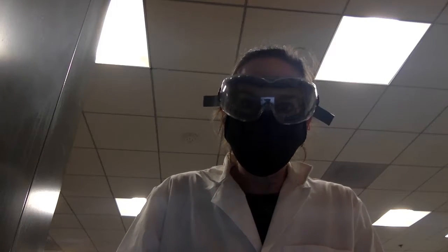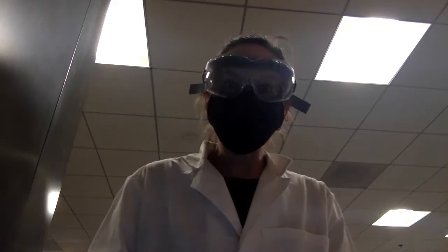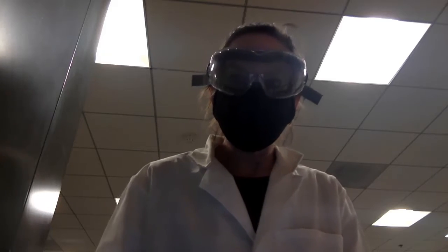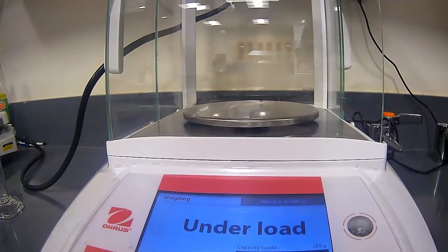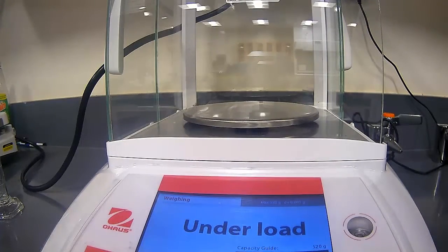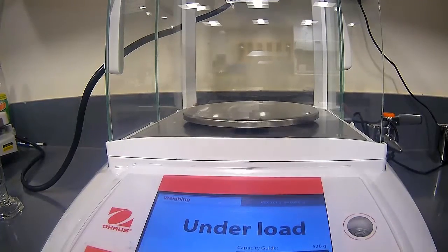Hi, it's me again, not just my hands working. In the second part of the experiment, we are going to be isolating casein from milk. So let's join me as we first start at the scales. So we're going to start the experiment by measuring out 20 milliliters of milk. But we want to know the weight of that milk so that we can do a weight before and after when we do our precipitation reaction.